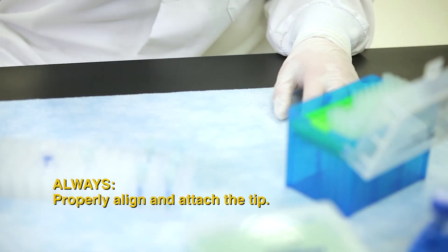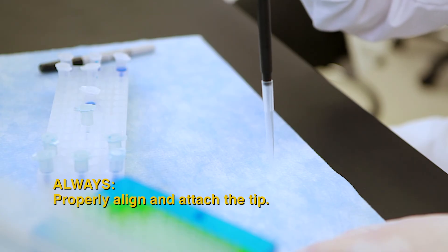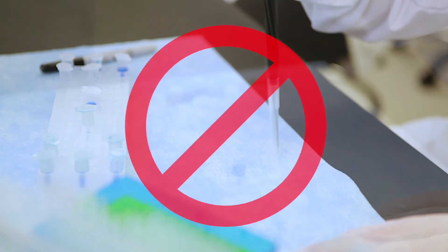When putting the tip on the pipette, do not slam your tip onto the table. This ruins the bottom of the tip, plus it introduces unwanted contamination.